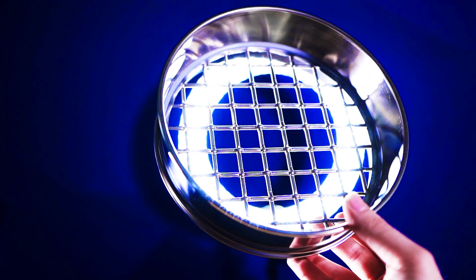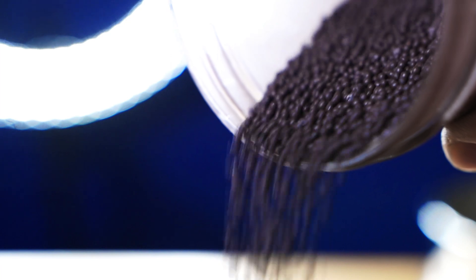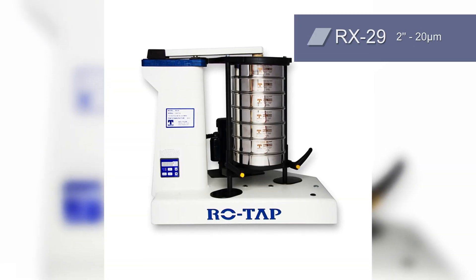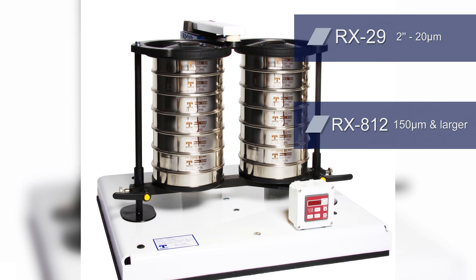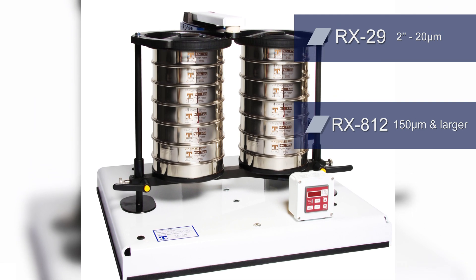Since there are a lot of test sieve shakers on the market, determining which shaker is right for you ultimately comes down to two factors: the material you're testing and the diameter of your sieves. Test sieve shakers are designed to test anything from coarse aggregate to finer materials like flour. Certain shakers work better than others depending on the size of the particle you're working with. For example, the ROTAP RX29 is ideal for particles ranging from 2 inches down to 20 microns, while the RX812, which uses just a singular oscillating motion, works better for particles that are 150 microns and larger.